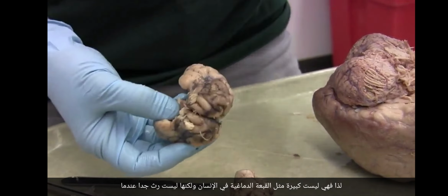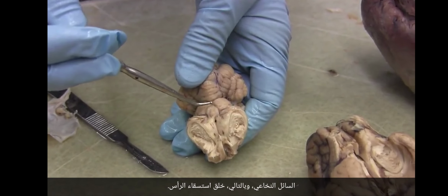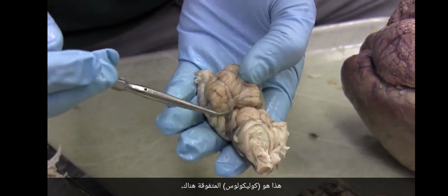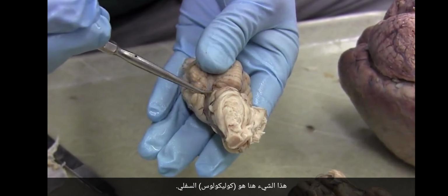And so this is a dangerous thing because it could grow and increase intracranial pressure. That would be a problem. It can also grow and press down and block the flow of cerebrospinal fluid and thereby create hydrocephalus. So that's pineal gland. This is the superior colliculus back here. This thing here is the inferior colliculus.